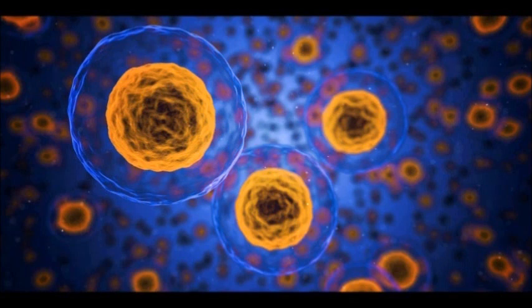In my replication of the Miller-Urey experiment, I demonstrated how amino acids could be formed from the atmospheric gases nitrogen and carbon dioxide, along with water vapor, by passing a high voltage spark through the mixture. These amino acids could potentially rain down from the atmosphere and mix with the water deep beneath the earth in the basin of a geyser, where they would be subjected to extreme temperature and pressure.